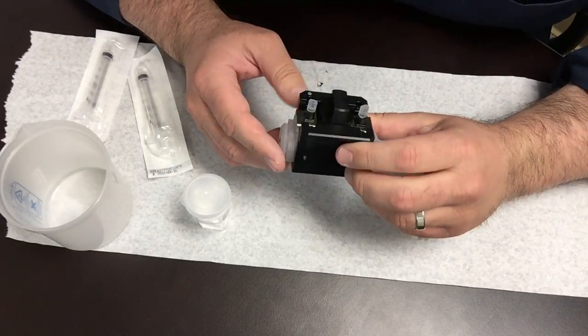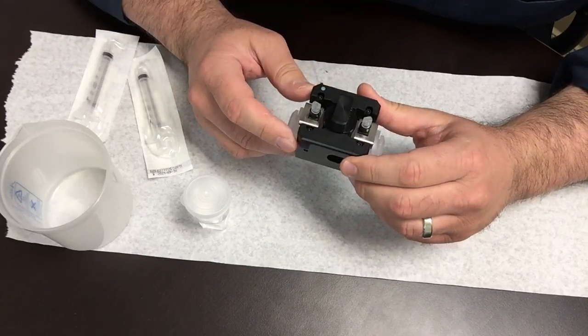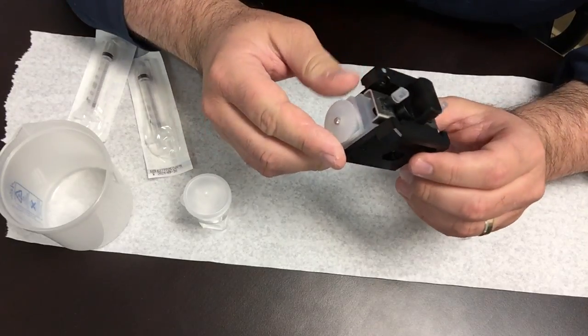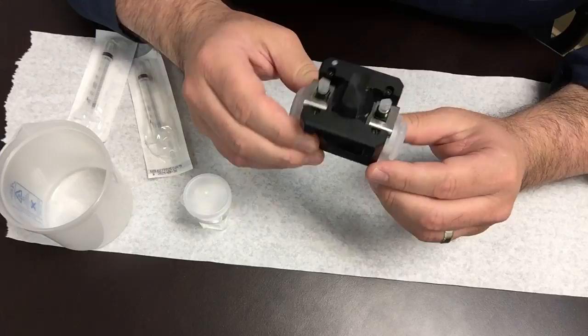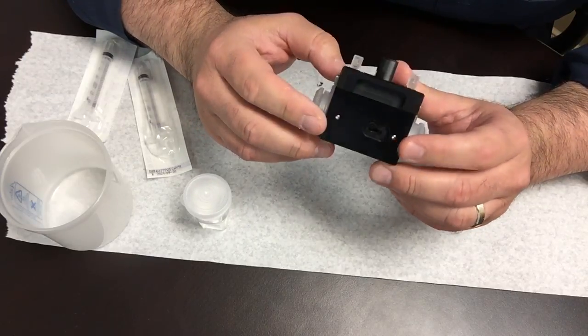This is a demonstration of the flow cell for the Nano Plus HD, also for the Nano Plus and the Delsa Nano. You can see how the zeta potential flow cell is shaped a little bit differently than the usual zeta potential cells.